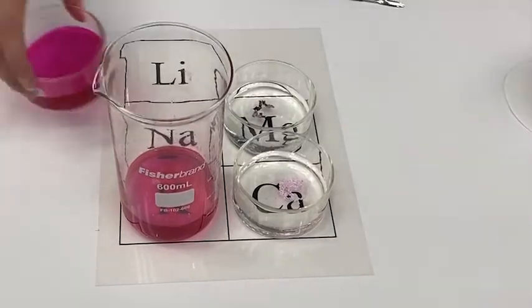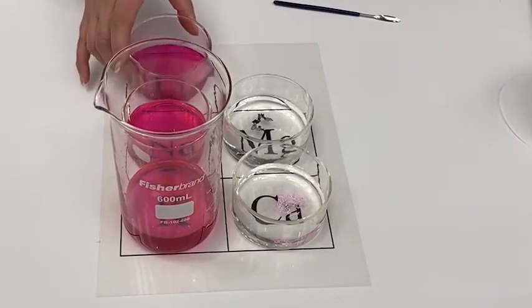When the alkali metal reactions are complete, we can see that they're all the same beautiful shade of phenolphthalein.